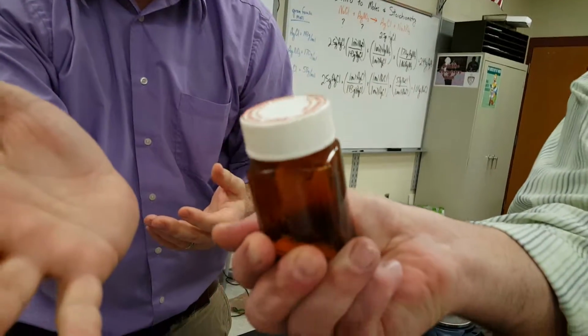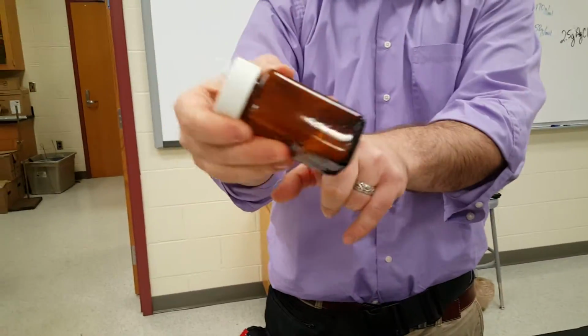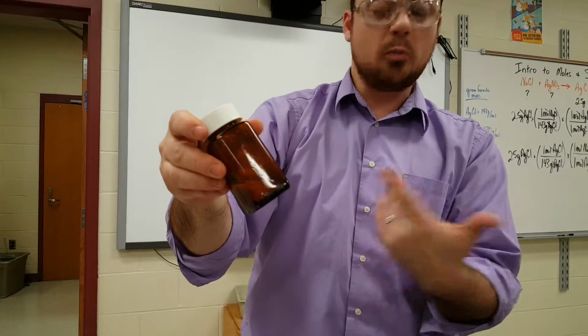It's not really hot, but it's a little warmer than I was expecting. Oh, it is a little bit warm. Oh, it's good. After that cold one, this feels better. Yeah, for sure. So this was an exothermic reaction. There you go. And what's the cool science name for the solid forming? Oh, precipitation. There we go.